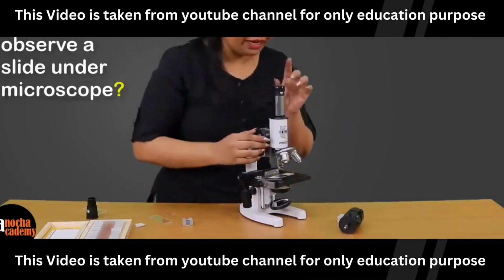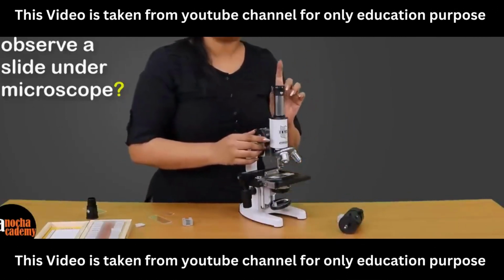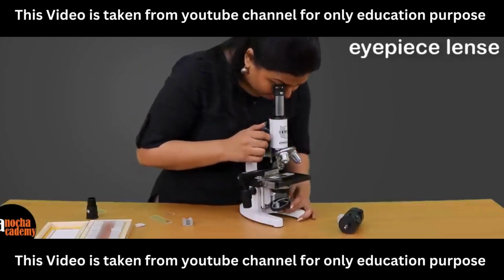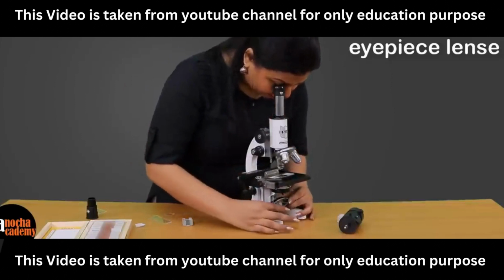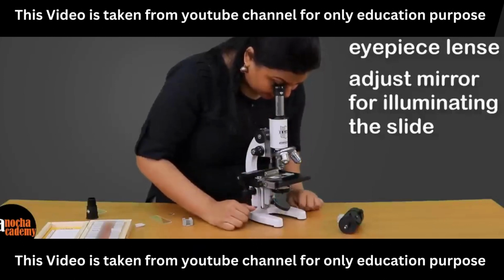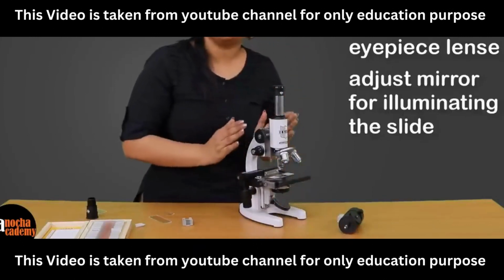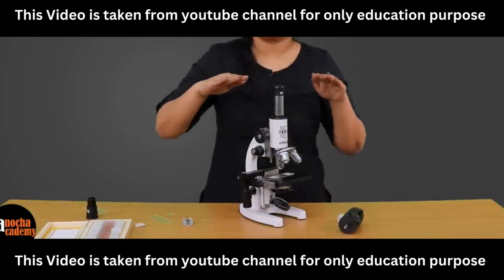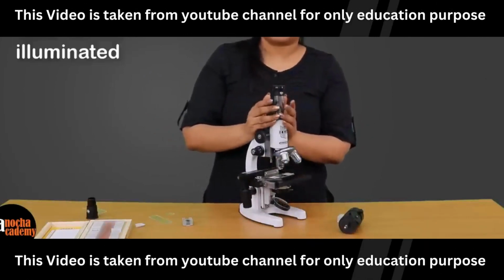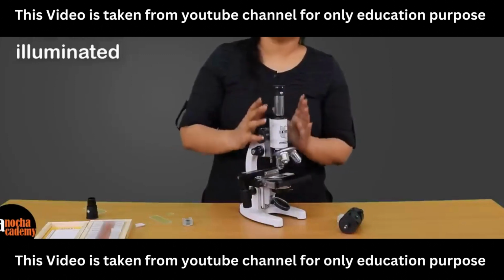We will have to place our eye on the eyepiece lens and make sure that the mirror is collecting enough light and focusing it on the specimen. When you do that, you will see that the entire field that you can see under the microscope is lighted up, is illuminated.